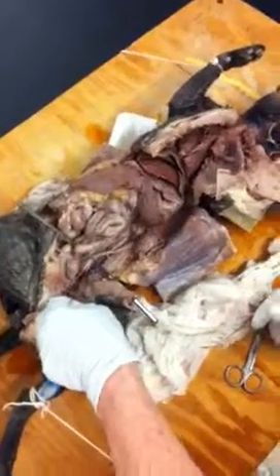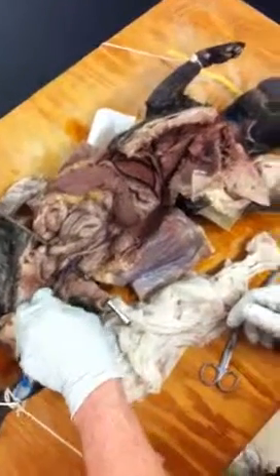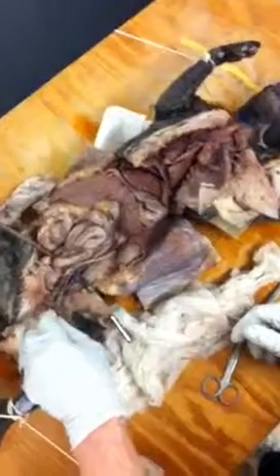That's the vena cava there? This is the vena cava where it's singular. So the vena cava is up here, and that's the blue. Where it branches, see this branch point? Okay, I see the branch. So here's the other piece of it.